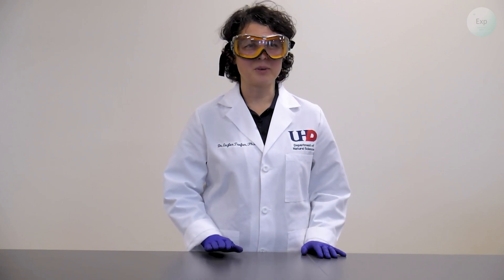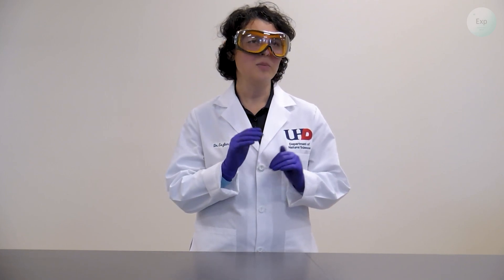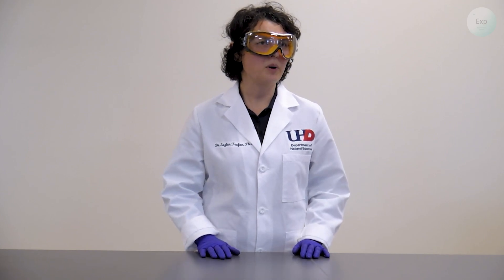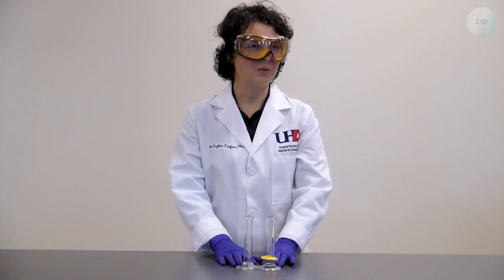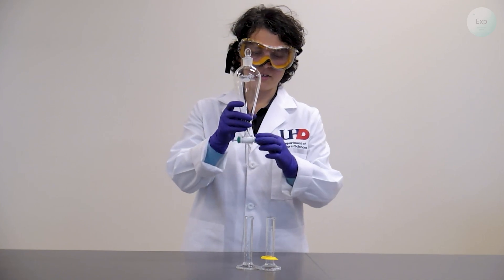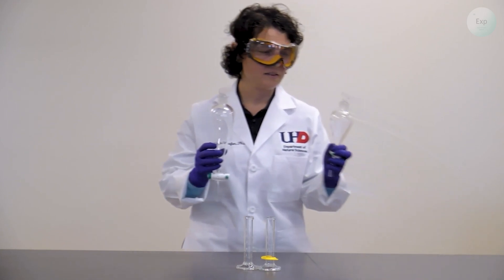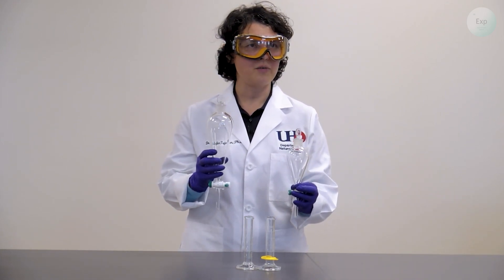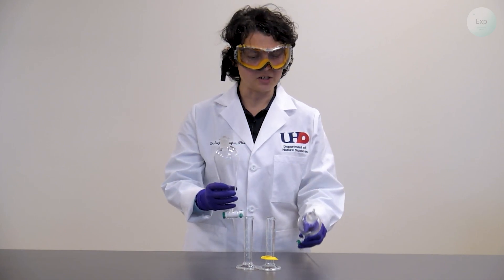For this experiment, I'm going to color the water so that I can show you the different layers more clearly, but you can do this with just simple water with no food coloring. I'm going to use two graduated cylinders to approximate the amount of water and hexane that will go into my separatory funnel. A separatory funnel always looks like this — there is a valve on the bottom, a cap on the top, and it comes in different sizes. This one is a 125 milliliter one, and this one is a 250 milliliter one. I will go with the smaller size for today.